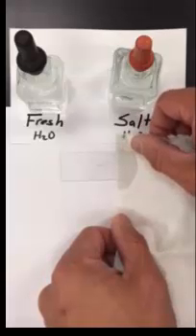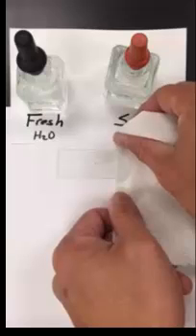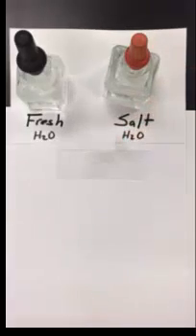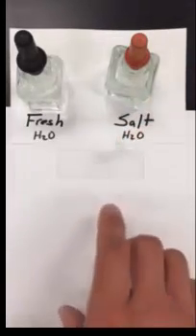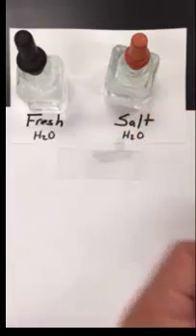Okay if you see the water stop moving and you still have a lot on the left then you may just want to move your paper towel to pull it a little bit more. Now you don't want to get too crazy because you don't want to dry out all the water that's underneath the cover slip. So just keep putting it there and using your paper towel until you have most of that water that you placed to the left of the cover slip pulled underneath the cover slip itself. So that looks good enough.